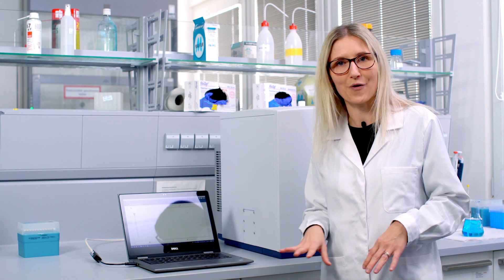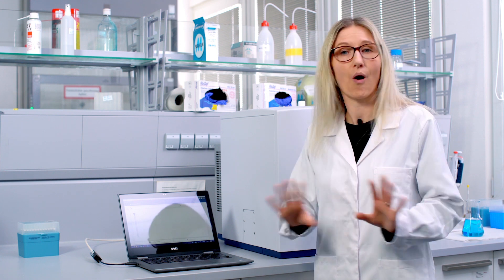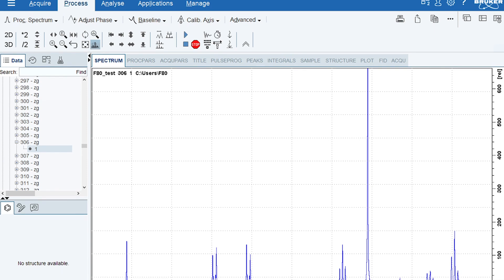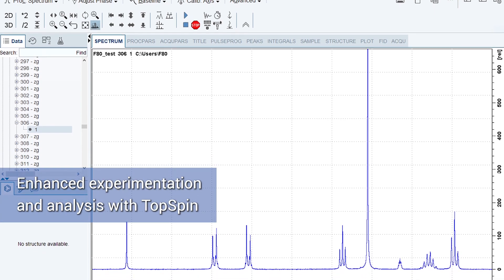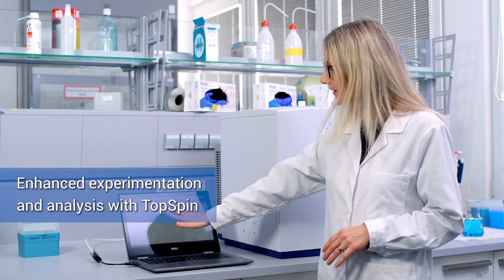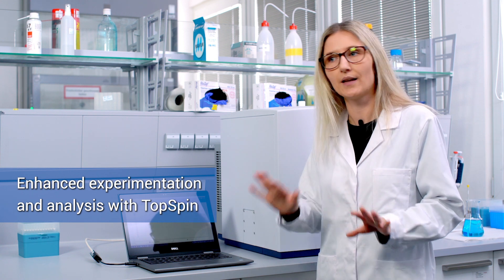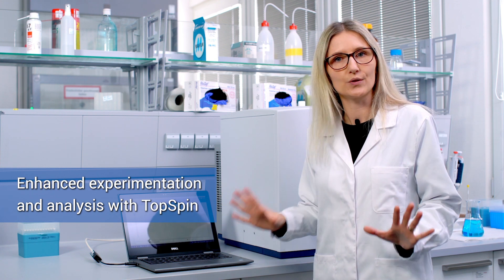If you want more flexibility and want to change parameters, that's also fine, because the Fourier80 can also be operated with our industry-leading software Topspin. You open it on the same computer and you can set up your experiments to your needs.